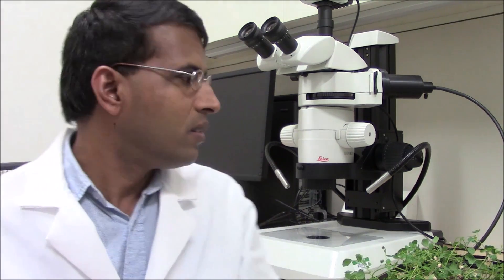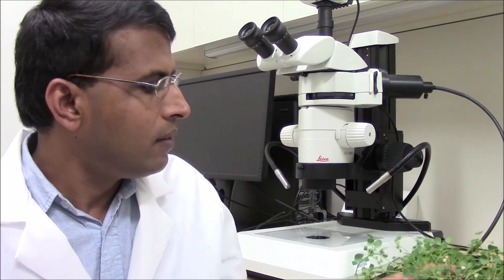I hope now you are all ready to see the genetic crossing using the keel petal incision method in Medicago truncatula R108 ecotype. Because Medicago flowers are so small, the genetic crosses are performed under a dissecting microscope similar to this. Grow healthy Medicago plants in medium-sized cups like this one so that it is easy to handle the plants while performing crosses under the dissecting microscope.